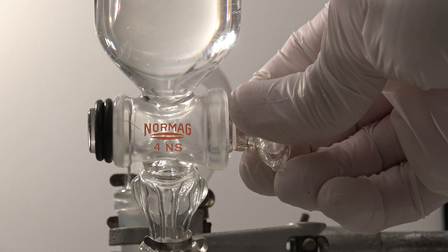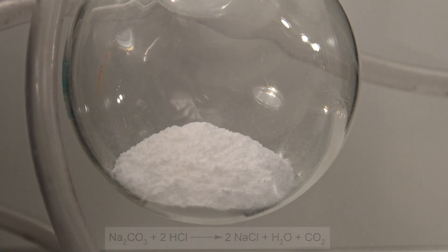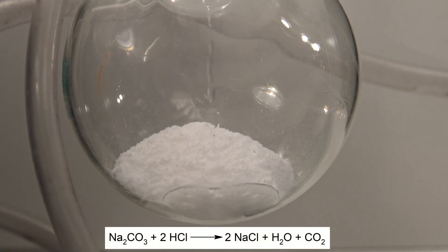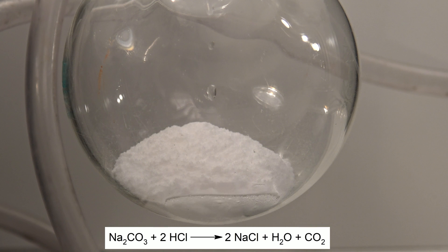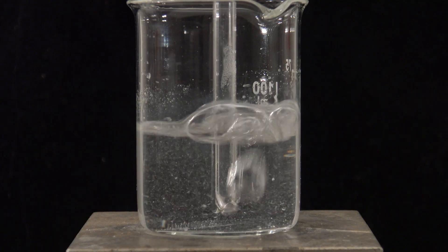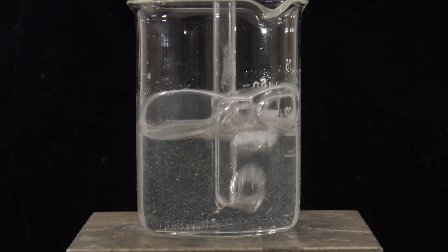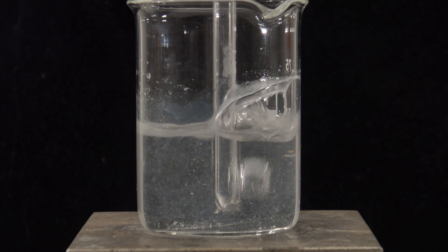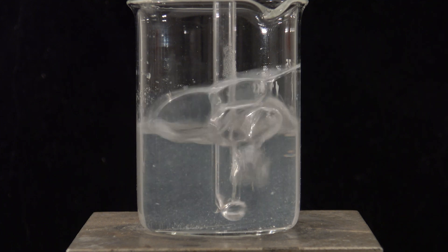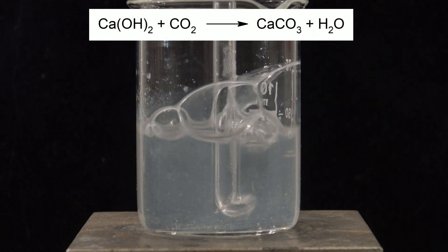Then the hydrochloric acid was added to the sodium carbonate. This caused sodium chloride, water, and CO2 to form. After the air had been pushed out of the apparatus and the CO2 got into the solution, a precipitate of insoluble calcium carbonate was formed immediately.